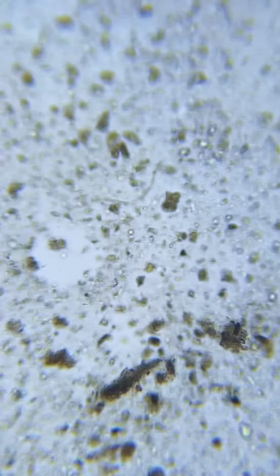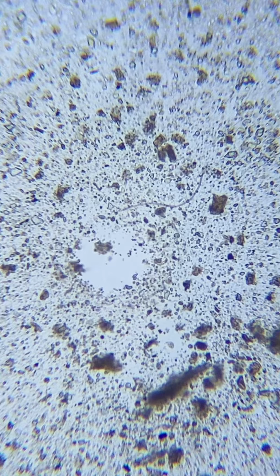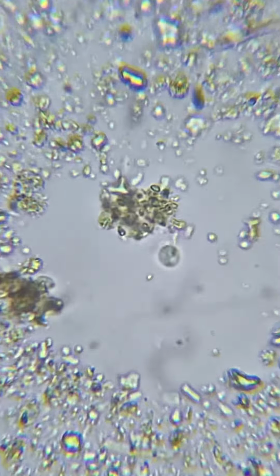Okay, here's an example of order and chaos. You see that circle dead center? Okay, so this signifies somebody's in here feeding, more than likely. It could be a motile bacteria, but it could also be a ciliate or a flagellate. So let's get a close-up view and see if we see anybody.